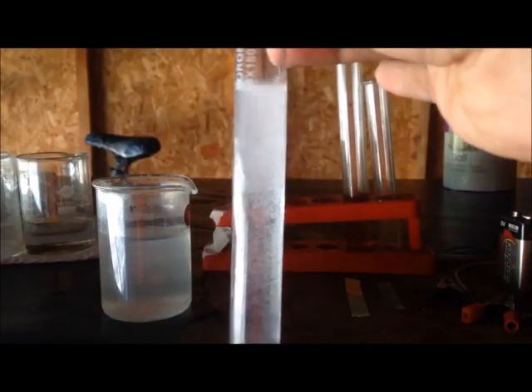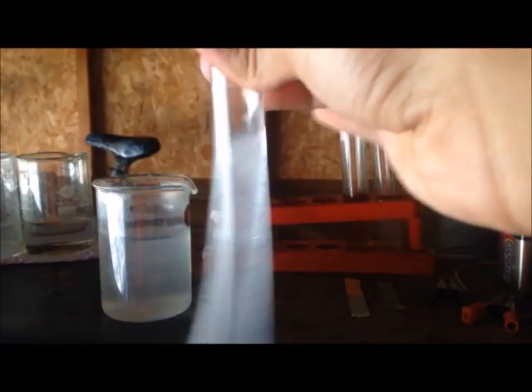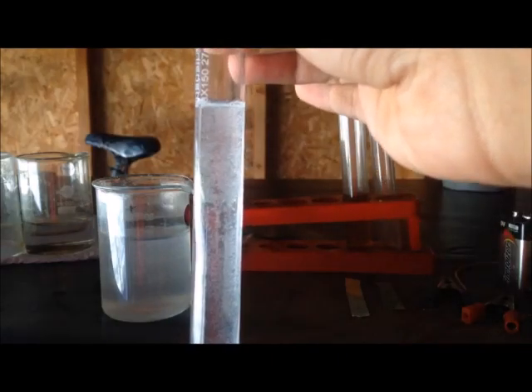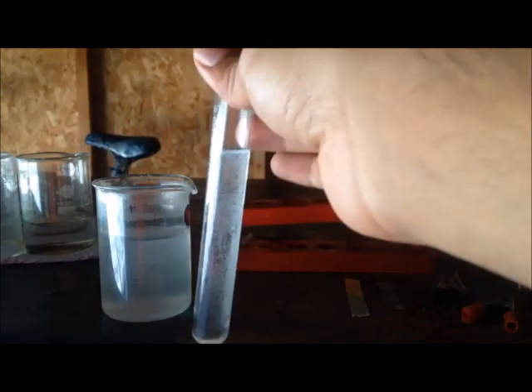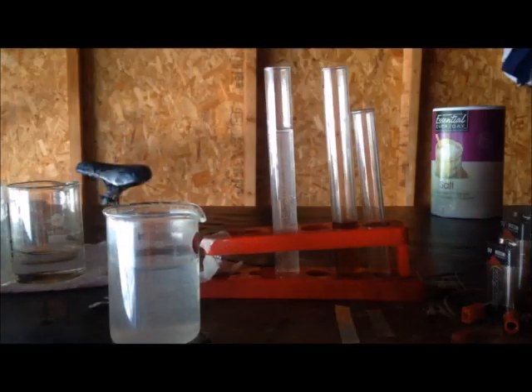I see here that the reaction is not really vigorous, and that's probably because the concentration of our bleach is not high enough. Another test we can do is testing the bleaching property of the sodium hypochlorite.